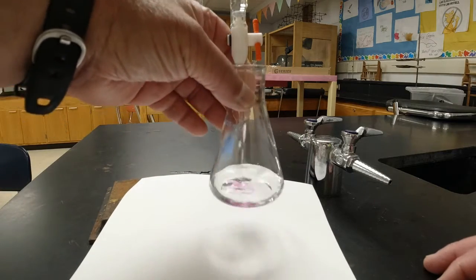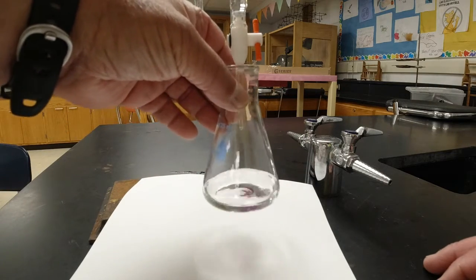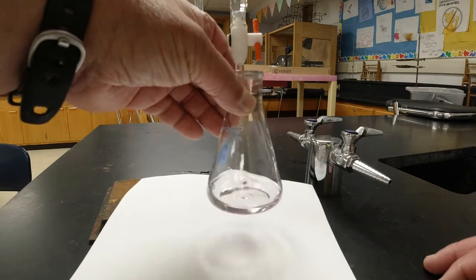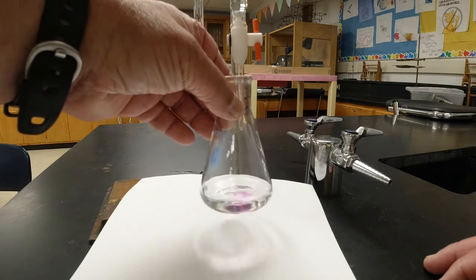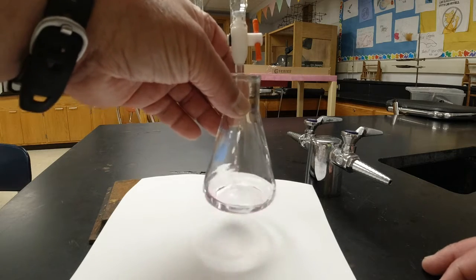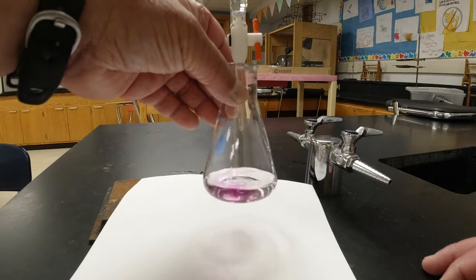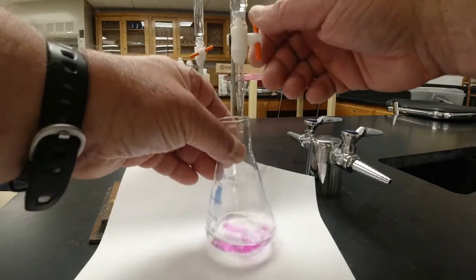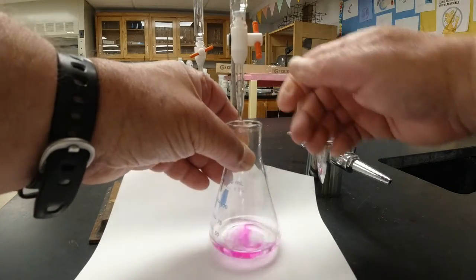All right, so you guys can kind of see in this other camera here, hopefully, that it is turning pink with every drop, and it stays a little bit longer each time. So it's just a drop every couple seconds that's showing up. All right, and I'm going to kind of slow this down a little bit because I think I'm getting close.